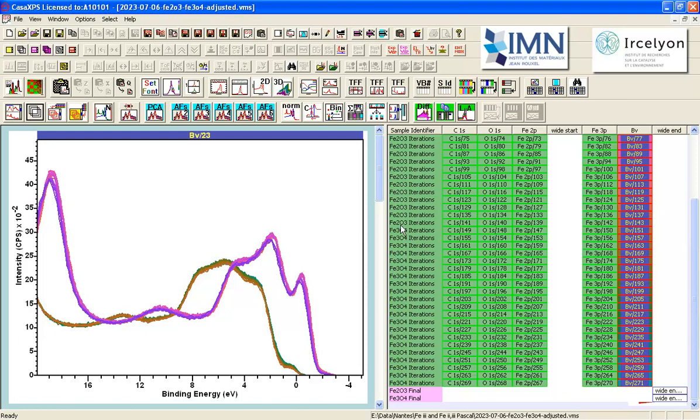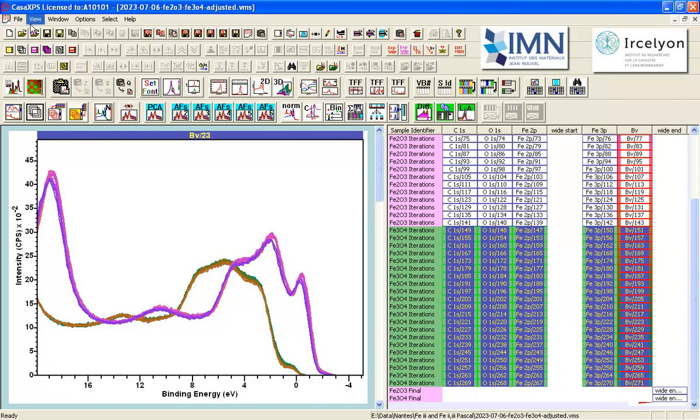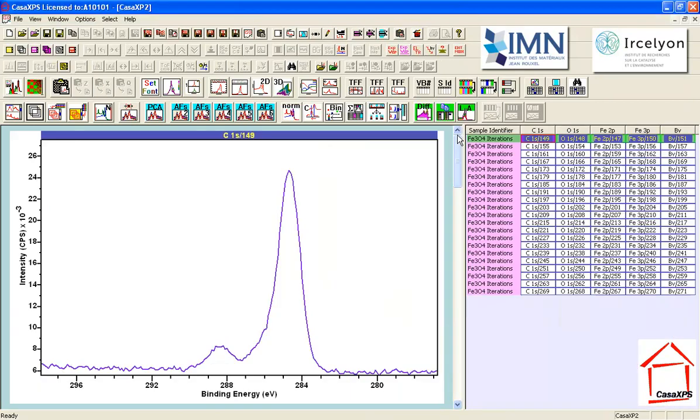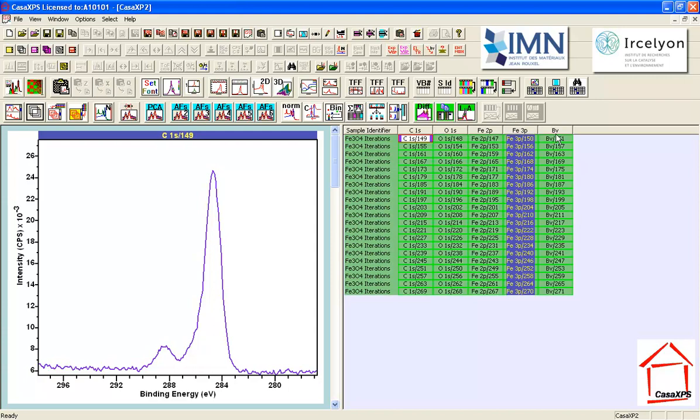To facilitate working on the Fe3O4 data, I'm going to select these and move a copy to a new VAMAS file. So I'm creating a new experiment frame, and I'm using the copy button, copy paste button, that will allow me to copy the selected VAMAS blocks from the other file into this empty file. So now I have my spectra of interest. These are the Fe3O4, and I would like to single out the Fe3P and the valence band.